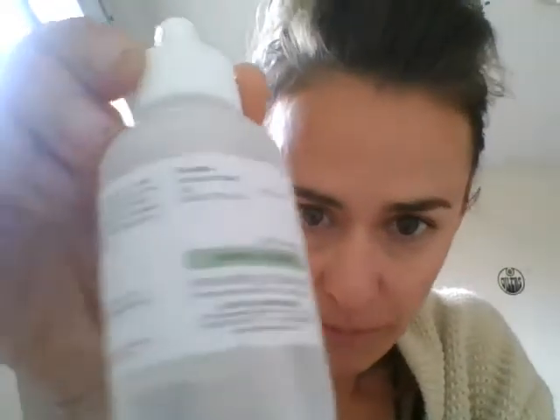Now, there's going to be other things that are going to be found in the water, of course, unless you have pure water. So our control that we're adding is just pure water. So deionized, like there's nothing in it. It's just hydrogen and oxygen, which is rare to find, just pure water like that. So there's going to be lots of different things in the other samples.